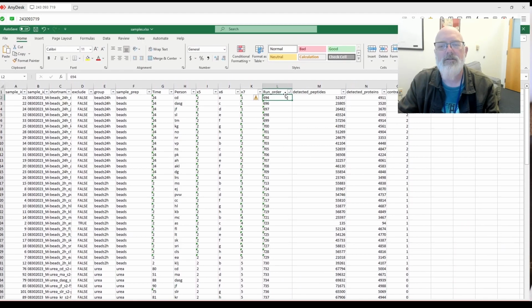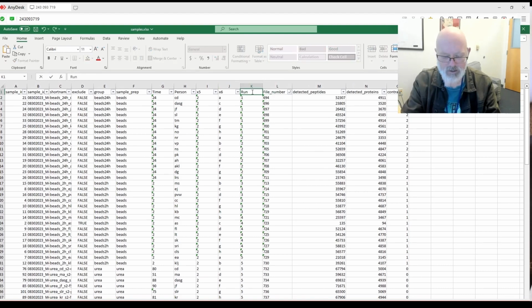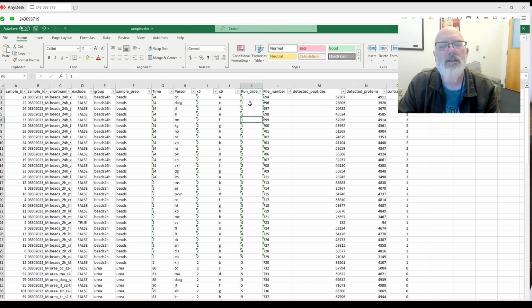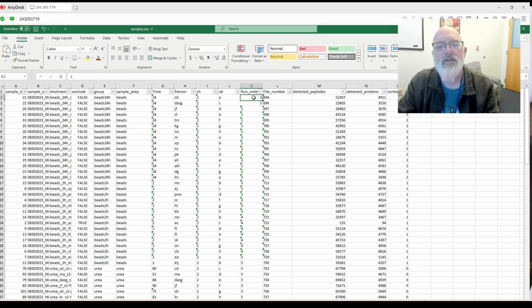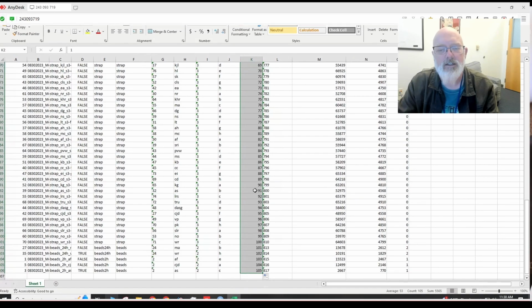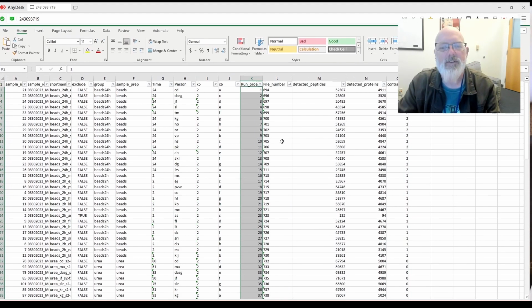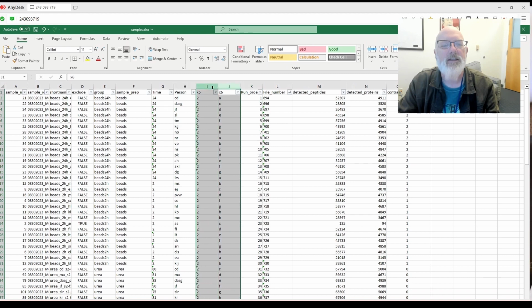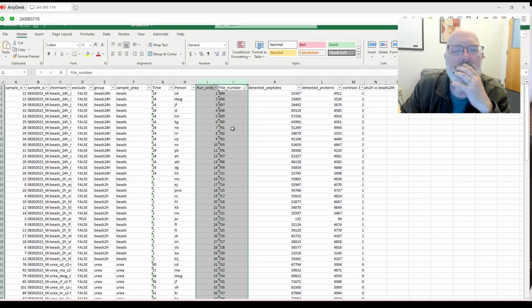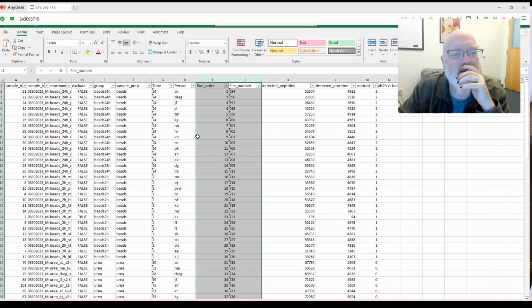What we can do is file number, and then this run order, because we don't need this. And then we can go 1, 2, make sure they're numbers, and then we can just drag this all the way down to here. All right, so this is run order 1 to 105, and we can see if there's any difference. We can delete these. That doesn't make any sense, and then I think that should work. Okay, so I think that's good.